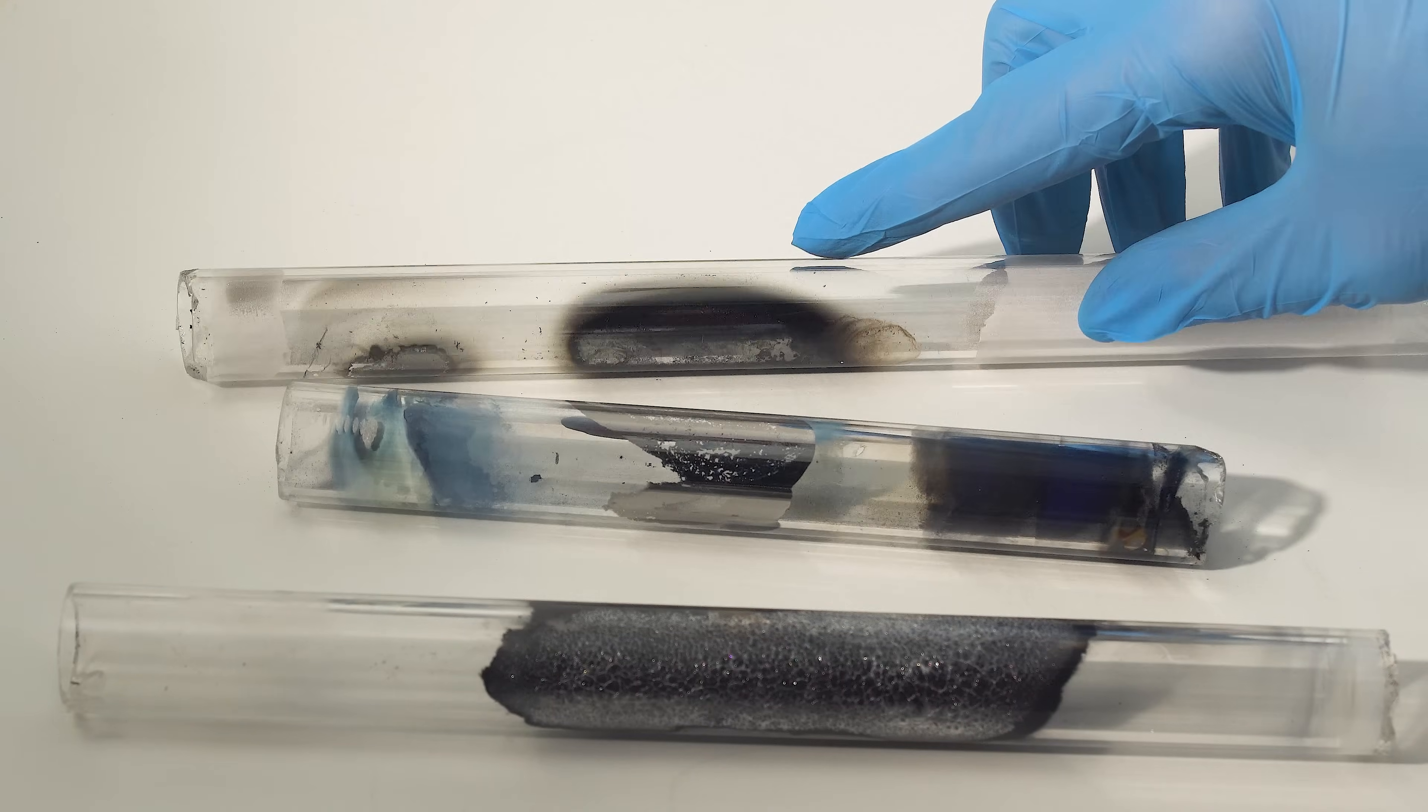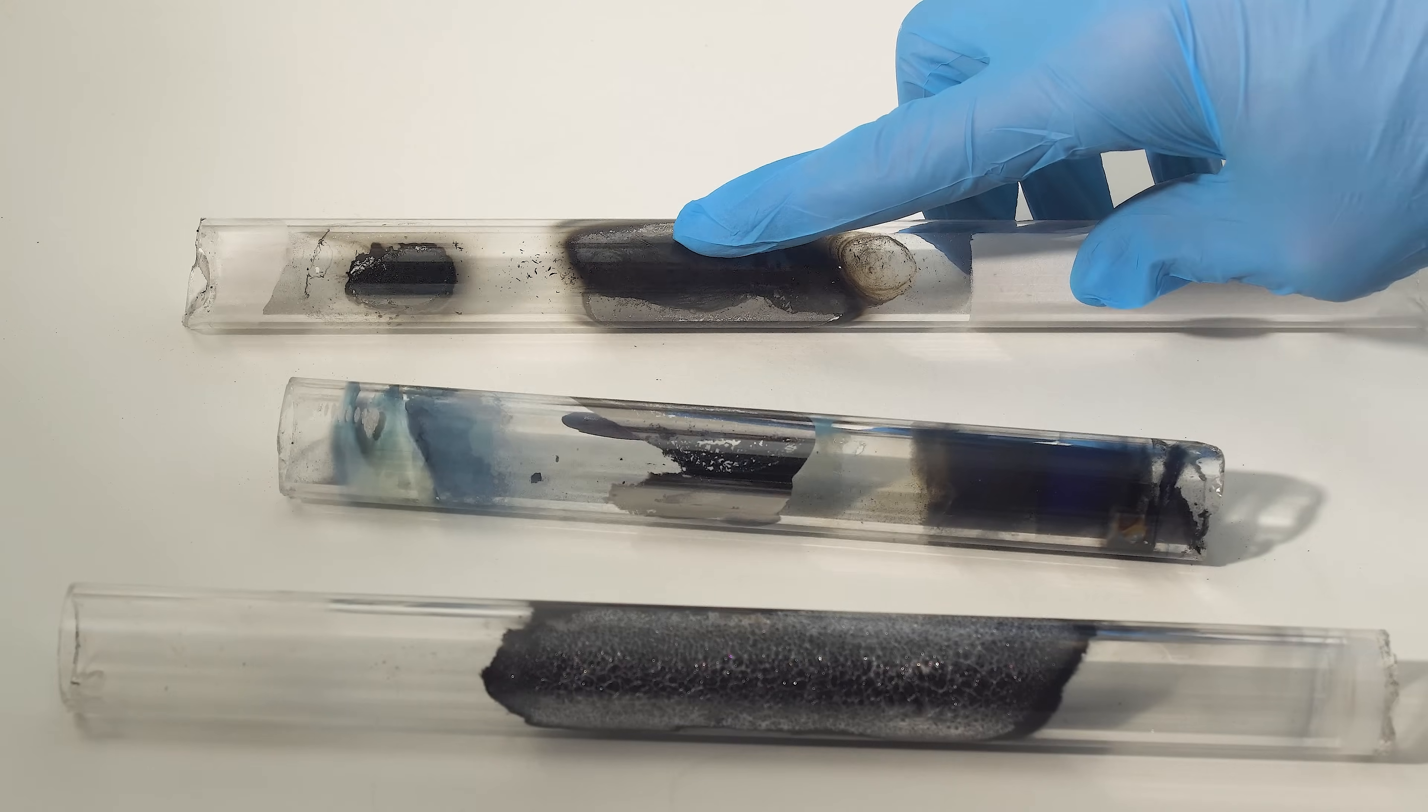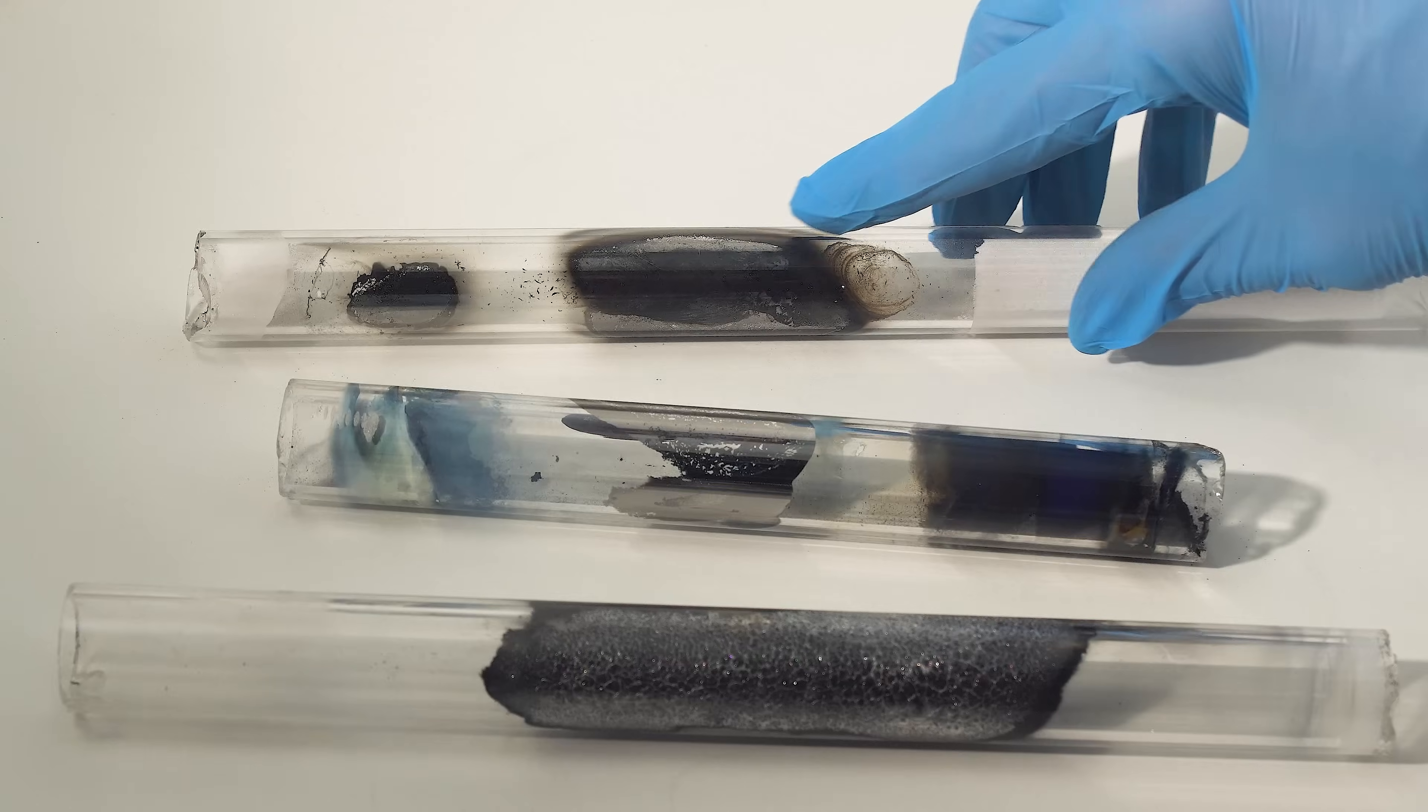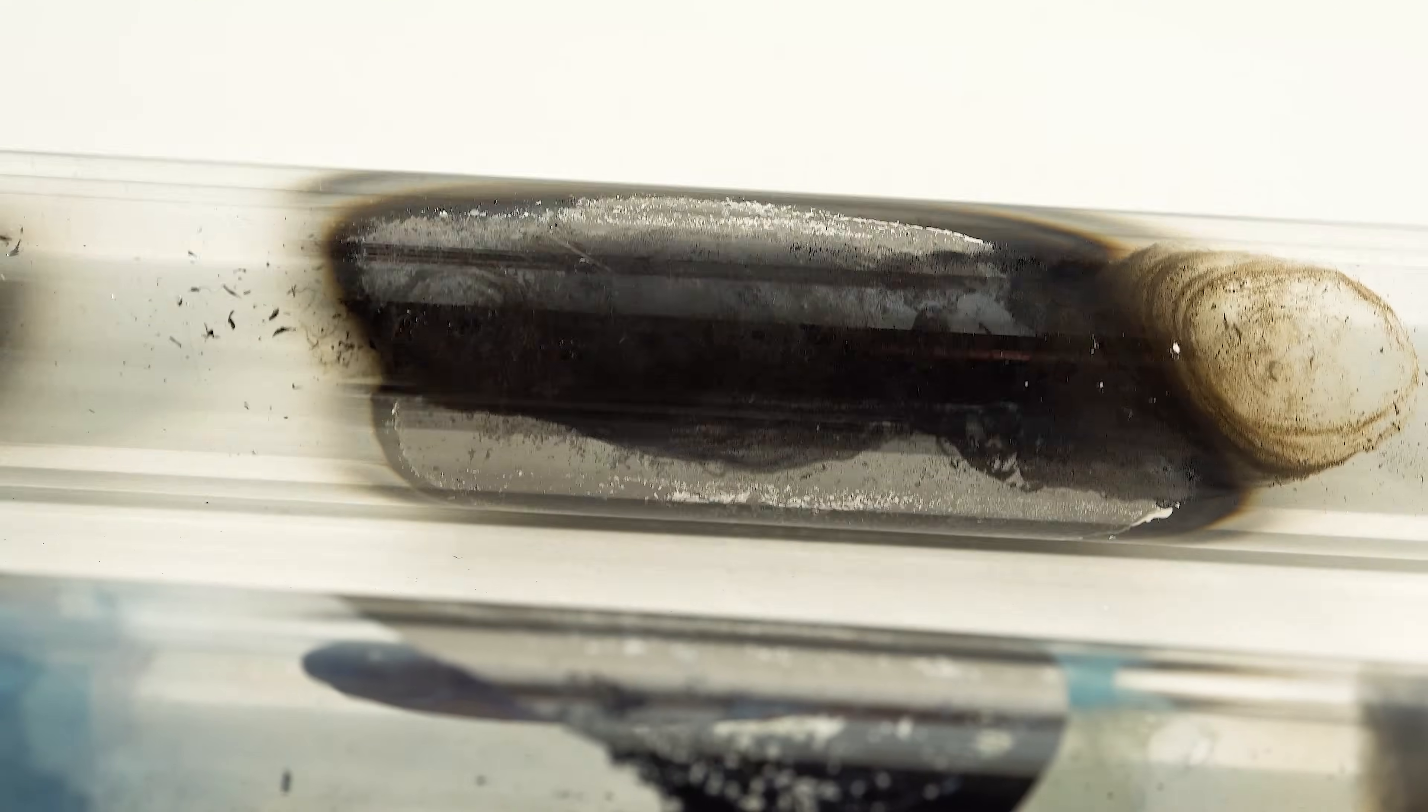Hey guys! Take a look at these quartz tubes with black spots. These spots are a thin layer of tungsten that resembles a mirror.